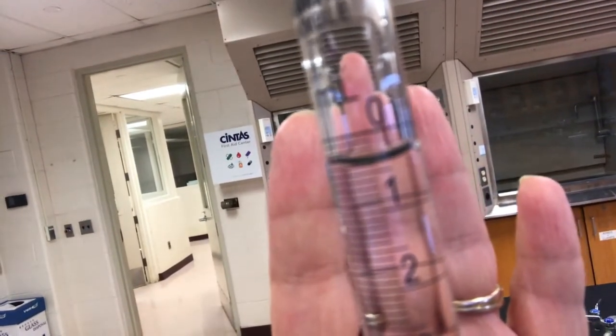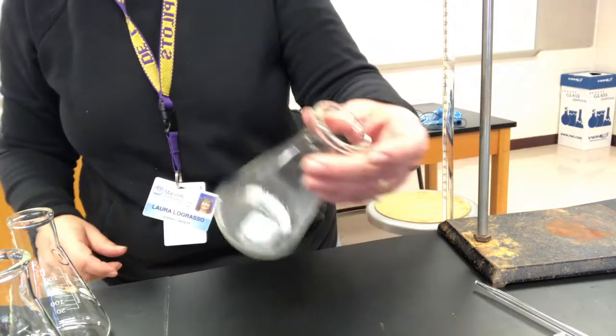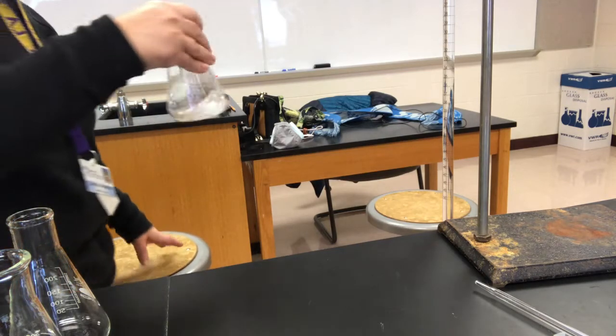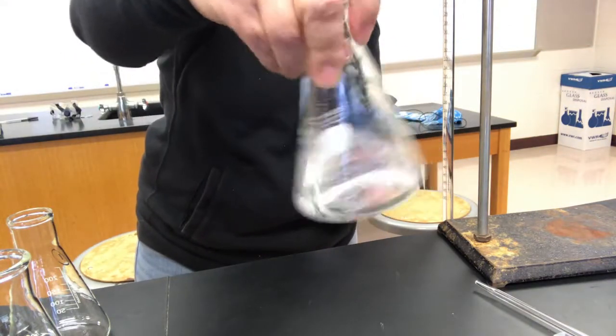Oh, that's our initial volume for our first titration of the KHP. Now, to prepare the KHP, I have this Erlenmeyer flask here that has the dry KHP. This is number 1, and we're supposed to add a certain volume of water to it. Again, it doesn't matter how much you add as long as it is fully dissolved. And so I'm going to dissolve that up.